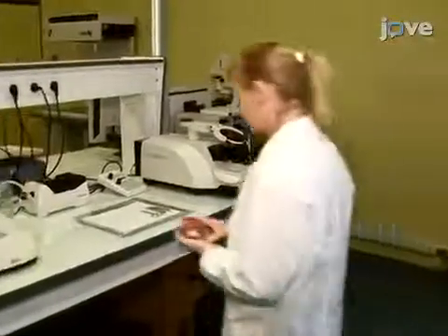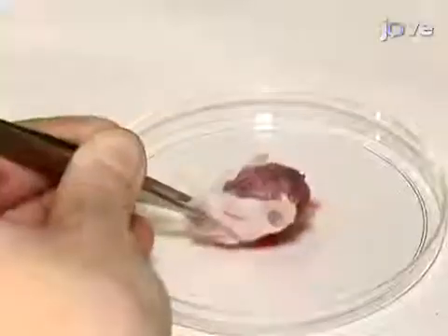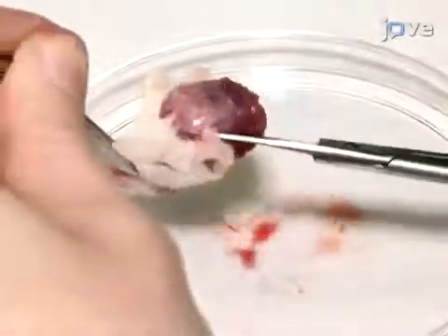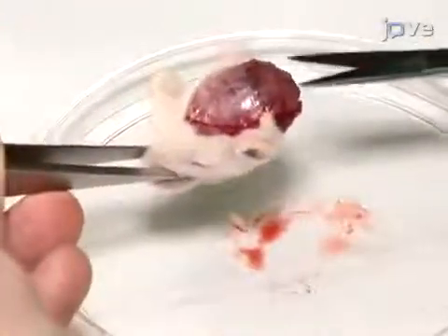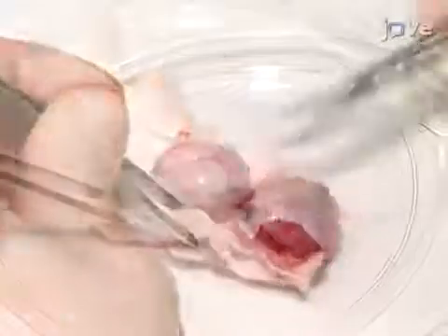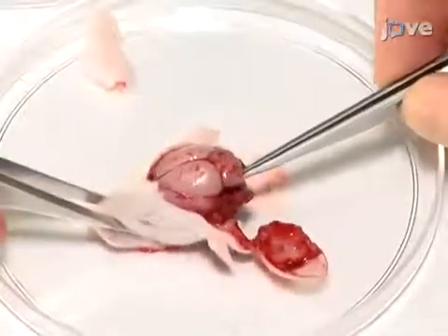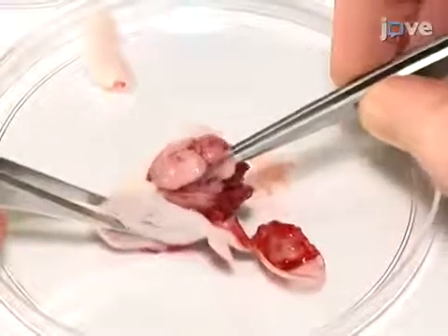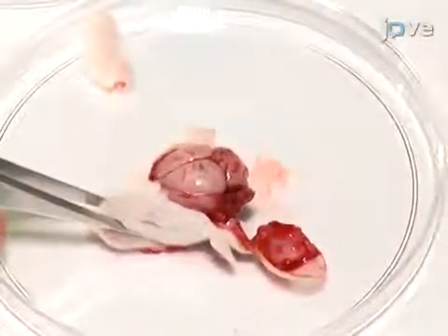Begin by having accessed the skull of a decapitated P10 rat pup head. Using fine iris scissors, delicately make 2 lateral incisions from the base to the rostral region of the skull. Then, remove the dissected skull with 2 No. 3 forceps, breaking any adhesion between the brain and the skull.